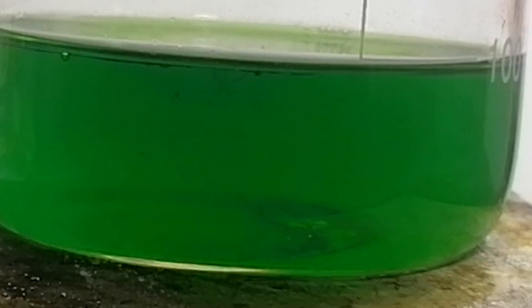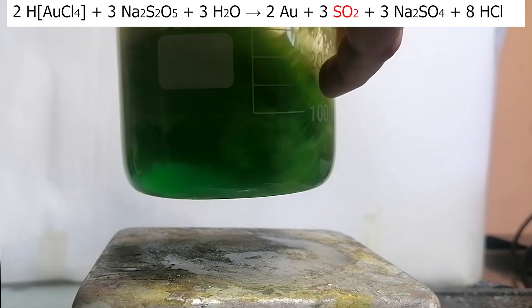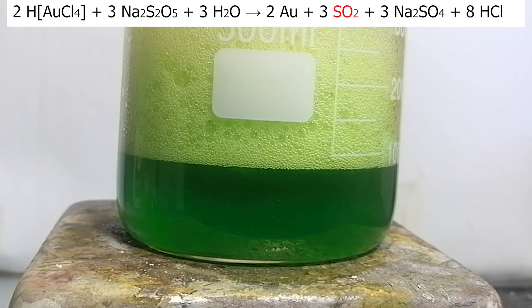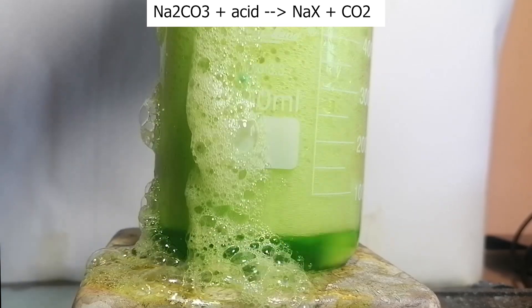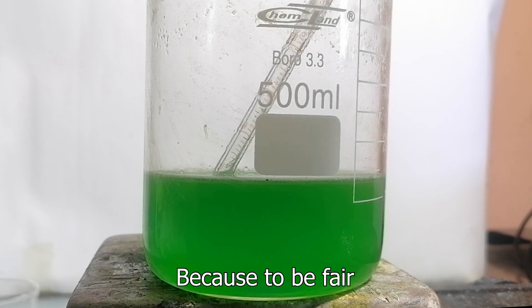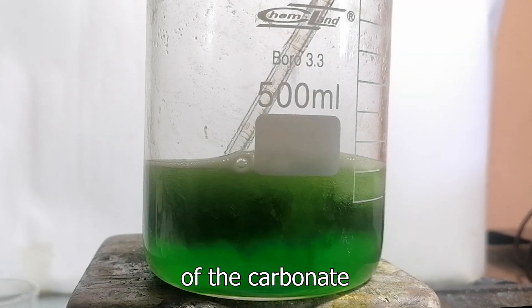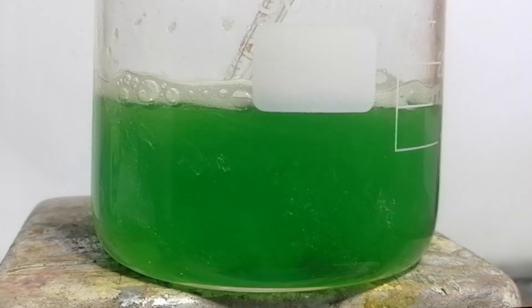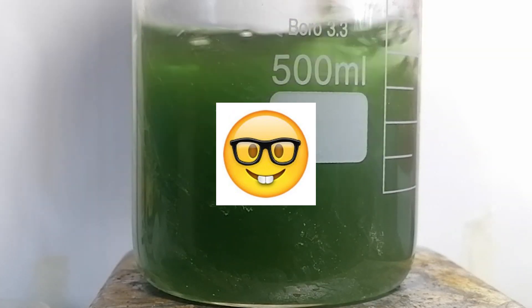Oh my god, it's gold! No wait, it's gone! What the heck?! I tried again and again and it kept redissolving. Something just snapped in me, so I started adding a bunch of sodium carbonate to neutralize the leftover acid because I was tired of being gassed by sulfur dioxide, which is an extremely irritating gas. The sodium carbonate made it overflow like 3 times because there was just so much acid! I'm so stupid — why did I add so much acid?! Anyway, I ran out of hydrochloric acid because I was trying to correct the pH. I tried hydroxide but hydroxide almost always overshoots the pH, so I wasted my 5 mls of additional hydrochloric acid. So I started using sulfuric acid to knock the pH down — and I must legally say that sulfuric acid is under 15%!